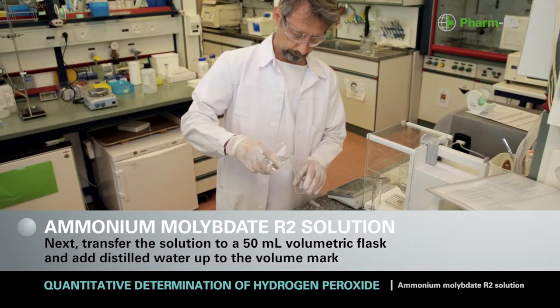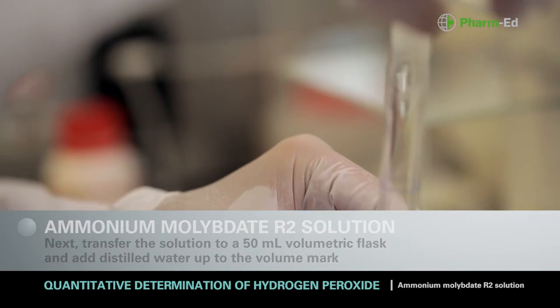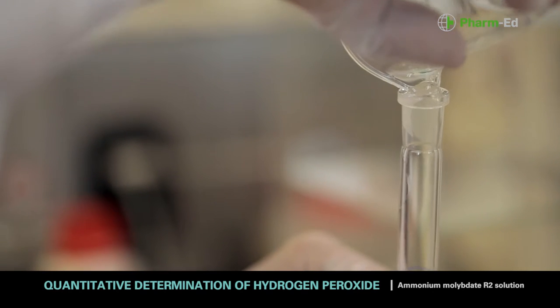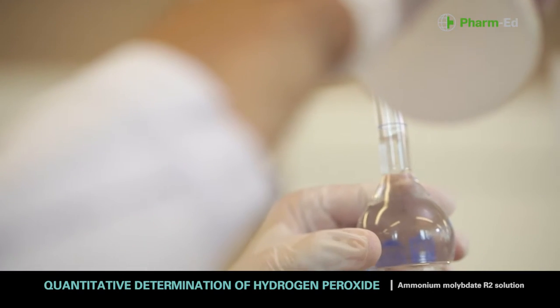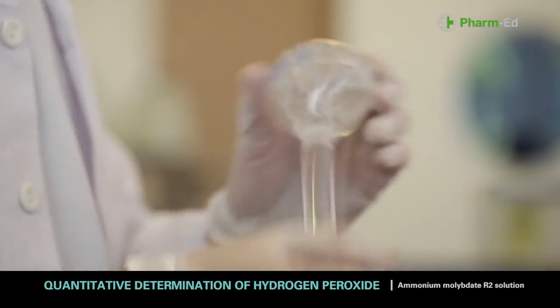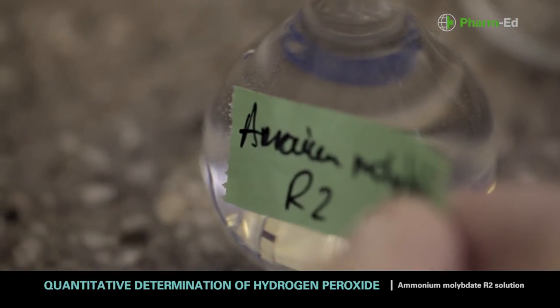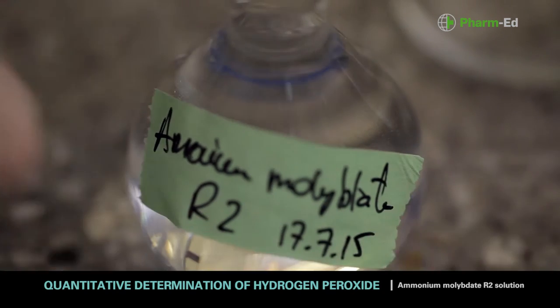Transfer the solution to a 50ml volumetric flask and adjust to the volume mark with distilled water. Close the flask and then shake to mix the solution. It is important to label the flask with the name of the solution and the preparation date, before moving on to prepare the next solution.